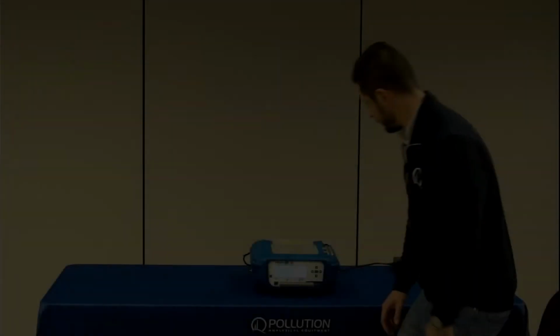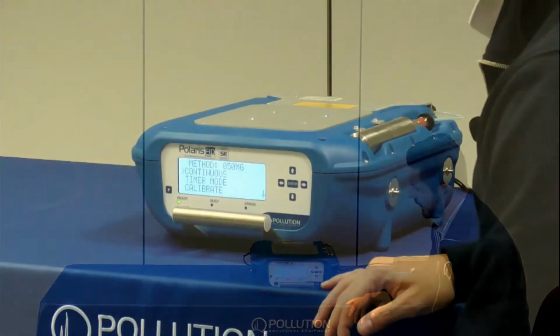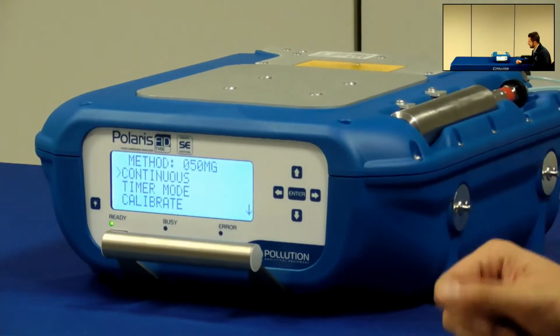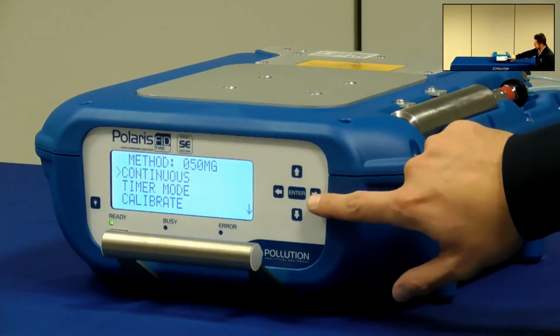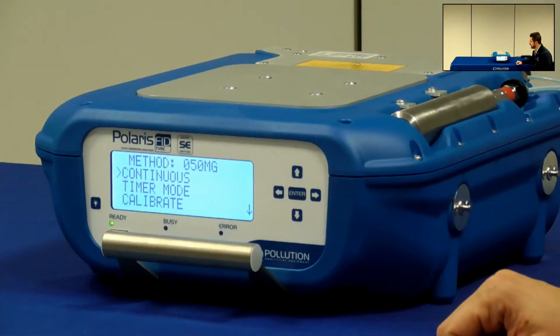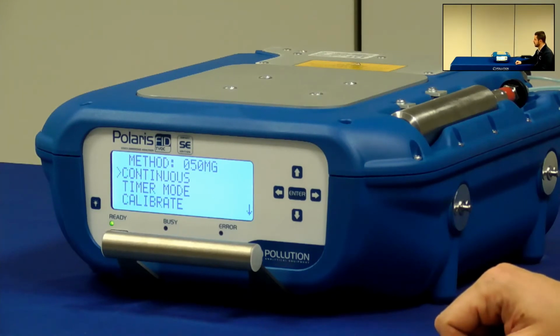campaign. When the instrument is ready and you are in the method menu, it is a good practice to do some preliminary activity before starting the proper analysis. Surely it is a good thing to monitor ambient air for 5 to 10 minutes before measuring the gas in the stack, so just pressing continuous. In this way, I can clean the internal tubings of analyzer and make sure that everything is stable.